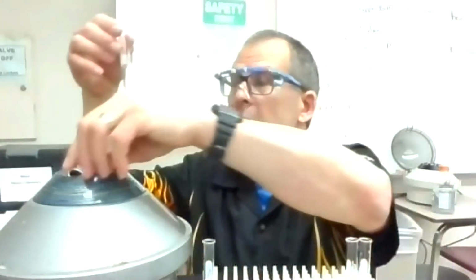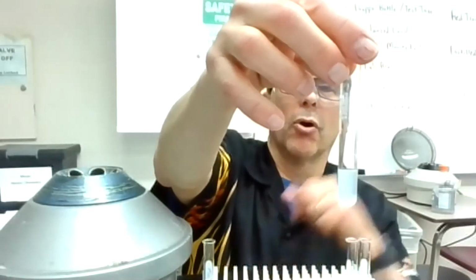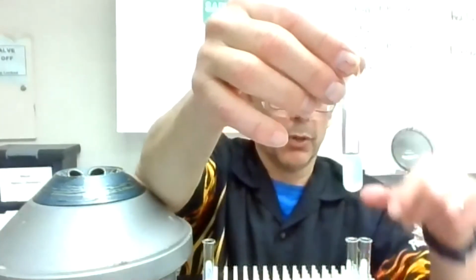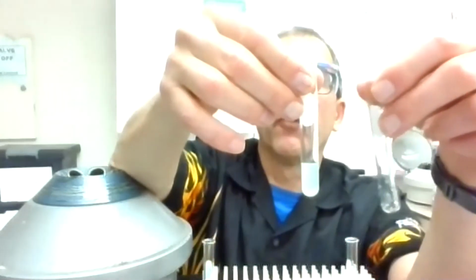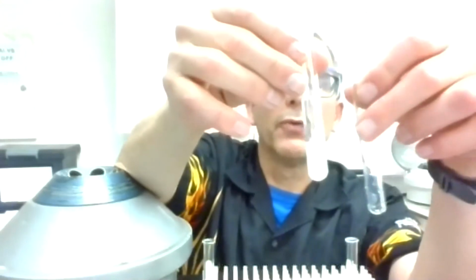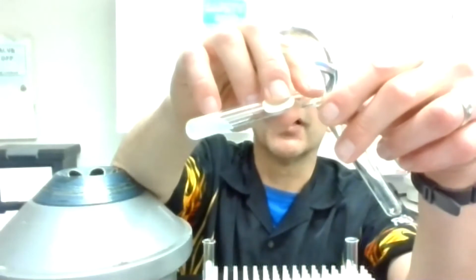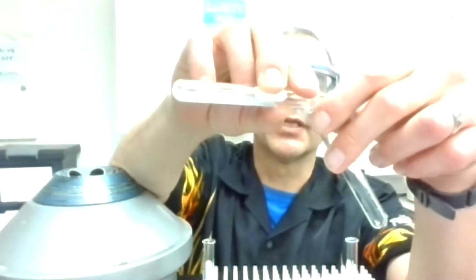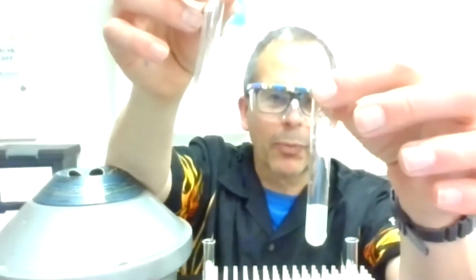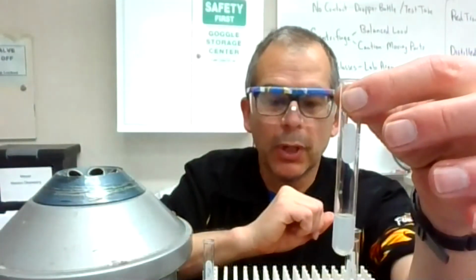This one is separated. It's kind of hazy yet, and I think we're okay to go with it. I'd prefer to get more of that haze out, but I think we did as good as we can do, and we'll still be able to tell from our next step. So we got that haze, but there's definitely a solid on the bottom. Don't know if you can see that. And probably an even bigger hint was as I added the drops, significant cloudiness. Now I could recentrifuge. Sometimes I can even skim off the liquid and recentrifuge it. It might look pretty cloudy on the mirror. It's hazy. It's not so bad from this view.